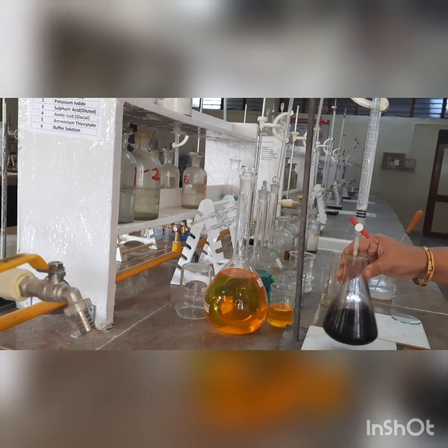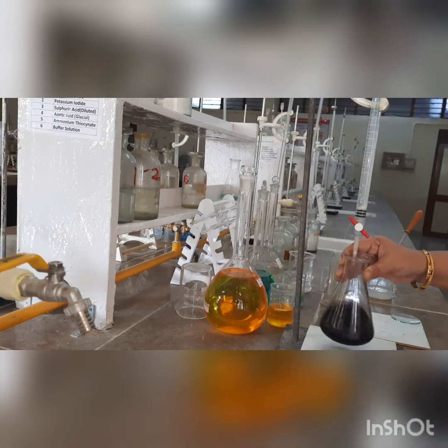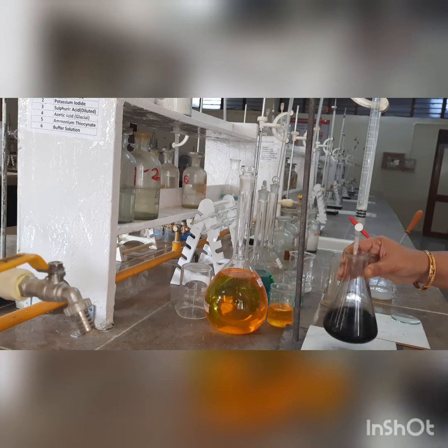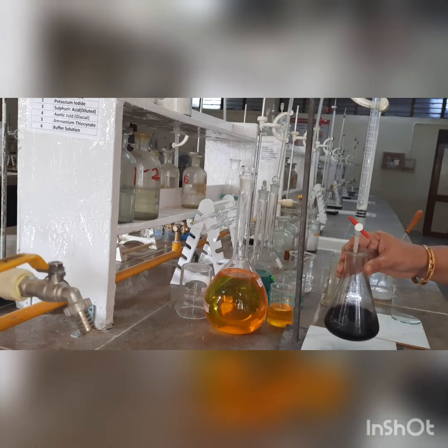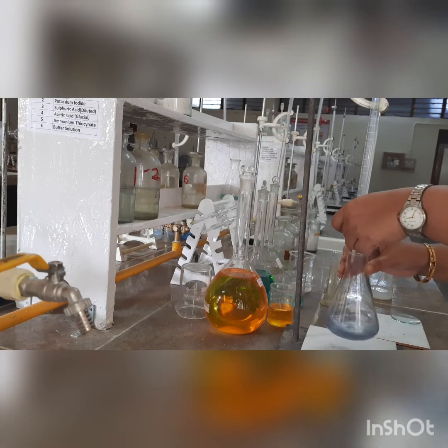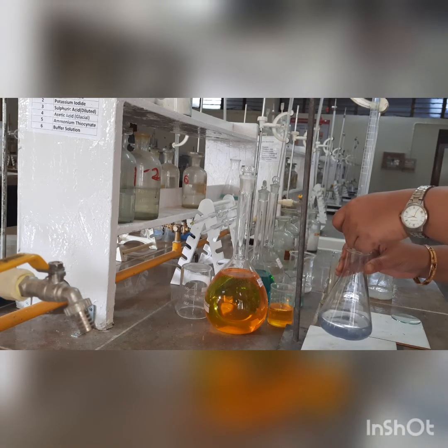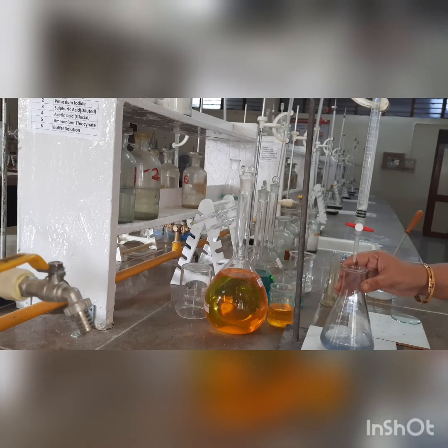We will maintain the dropwise pattern of introducing the burette solution. Alongside, we are going to continuously swirl the solution in the conical flask. The dropwise hypo is doing the reaction — this is the oxidation-reduction reaction going on; we are performing iodometry. You must have observed the color change just happened in a single drop — this is called a single drop color change. And this is the color which we are looking for. So this becomes the end point of the first part, that is standardization of hypo solution.